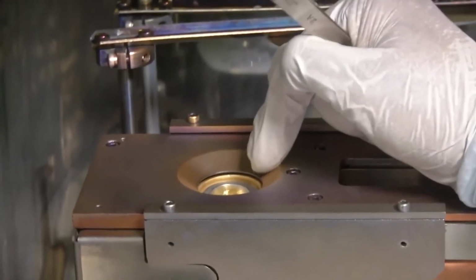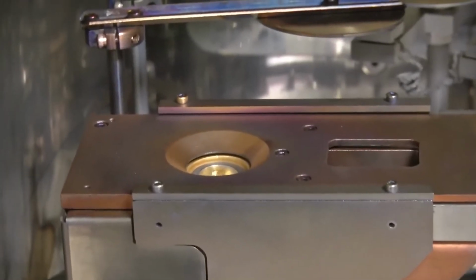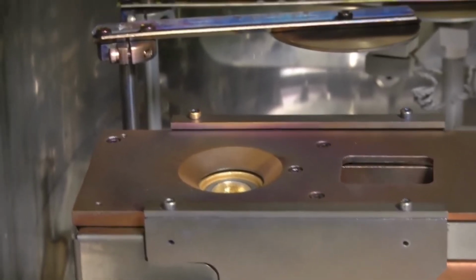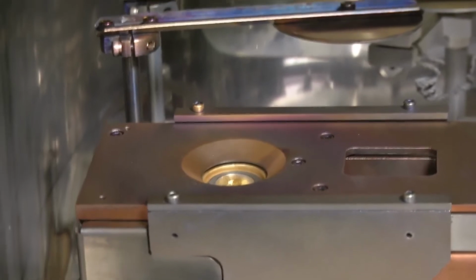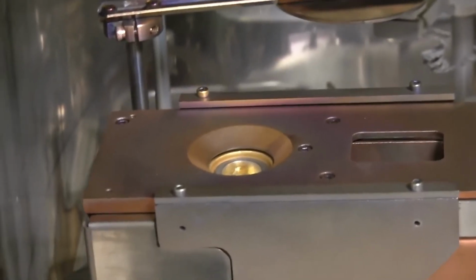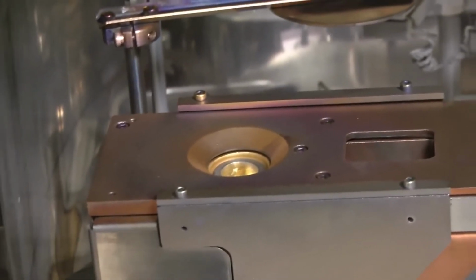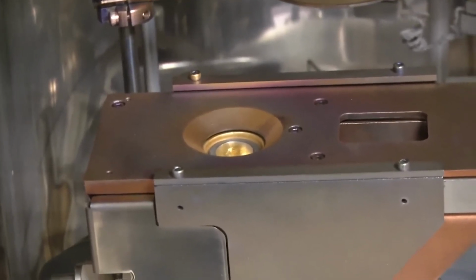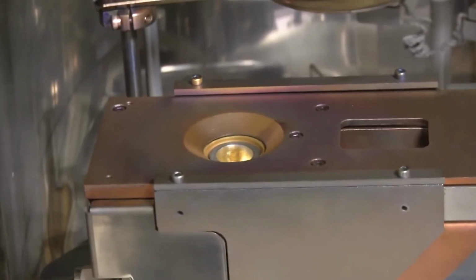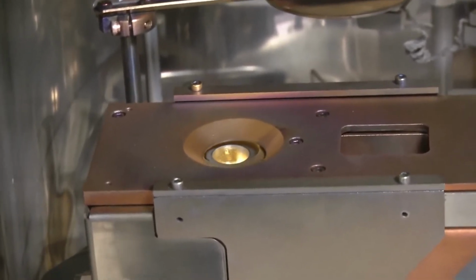For example, the crucible which you saw previously contained titanium, and the crucible which you are seeing now is gold. Similarly, there can be many such crucibles depending upon the system capability and intended application, which can be used for multi-layer thin film deposition, or an adhesive layer and then the final metal deposition.